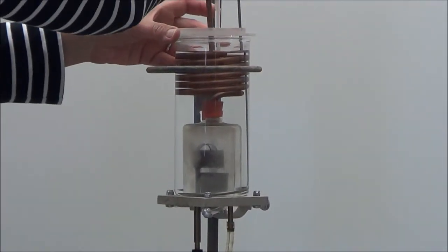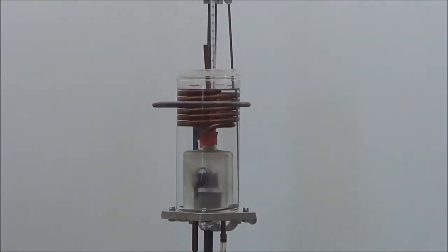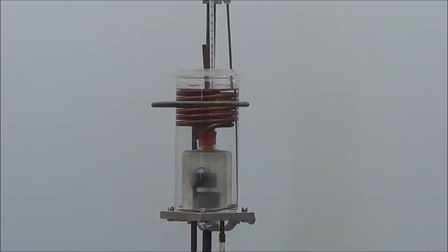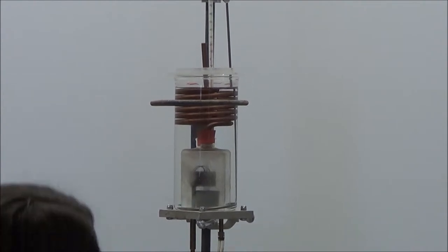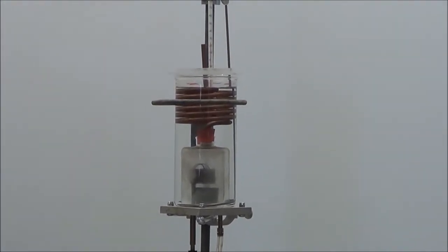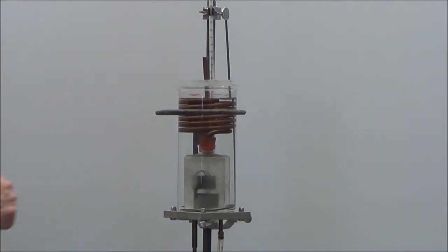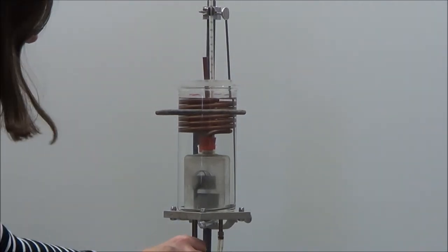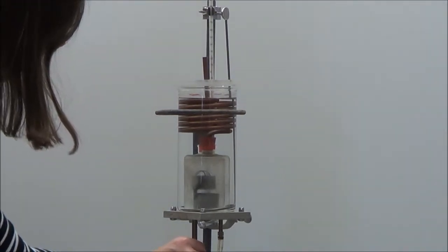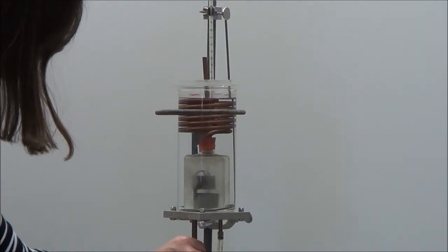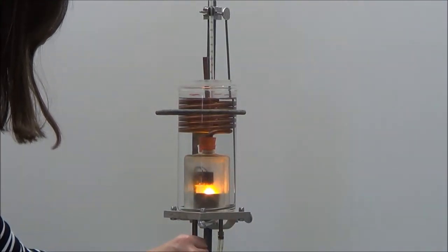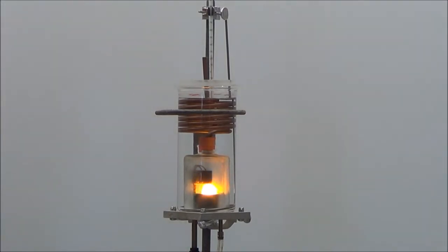Put the thermometer back down so I can see how the temperature changes. I'm going to turn on the oxygen. Let it flow for just a little bit. Now I'm going to turn on my power supply. My coil should get red hot. You can perhaps see it igniting in there.